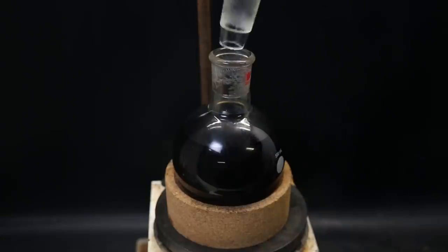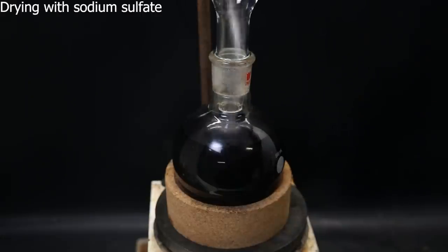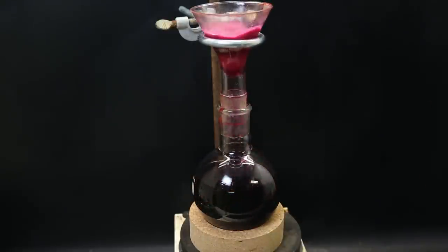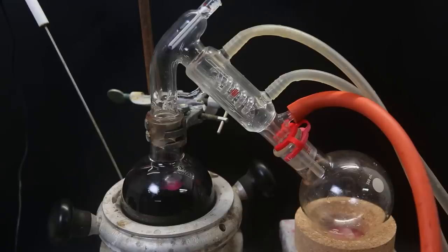I then take the combined MTBE extracts, and dry it with sodium sulfate. I filter the mixture to take out the sodium sulfate, and then set the filter top for short-path vacuum distillation, to remove all of the MTBE.